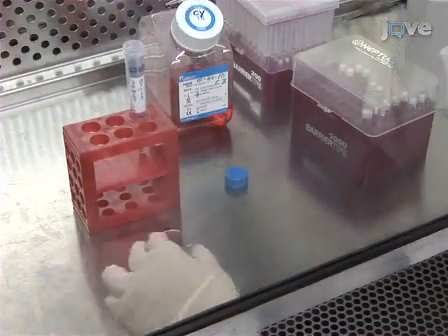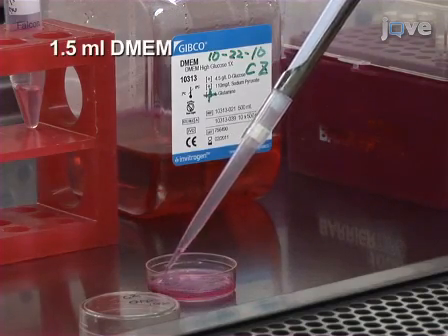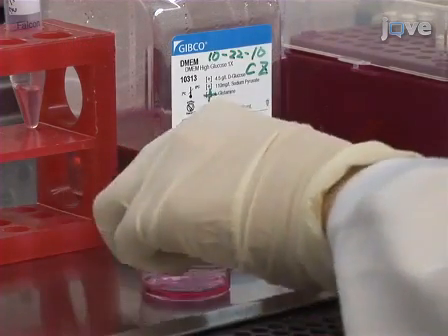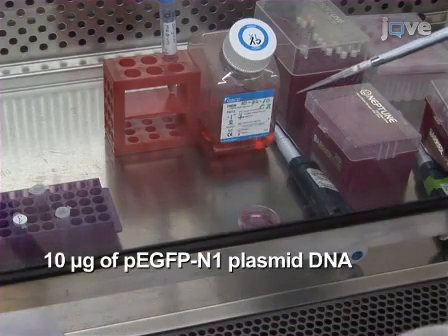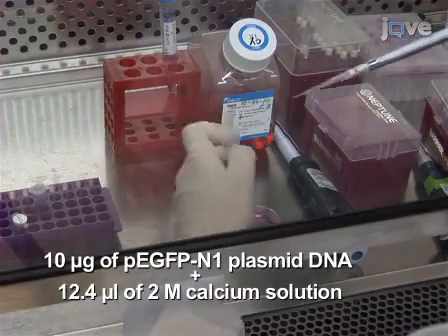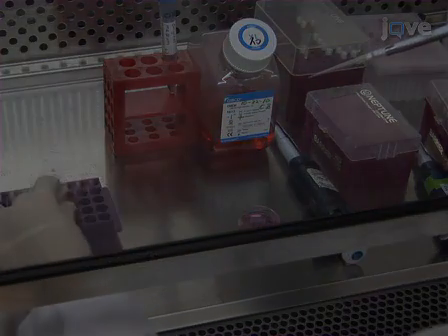Fill each 35mm dish with 1.5ml of Dulbecco's Modified Eagle Medium 30 minutes prior to transfection. Next, combine 10 micrograms of PEGFP N1 plasmid DNA with 12.4 microliters of 2 molar calcium solution and bring the total volume up to 100 microliters with sterile water.